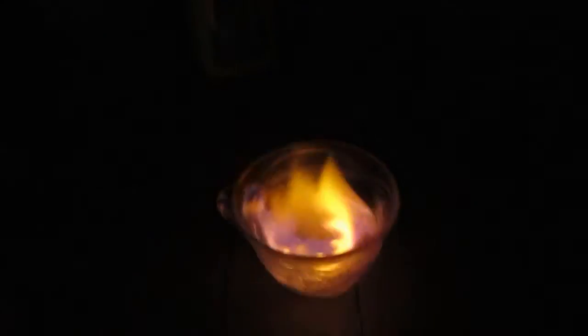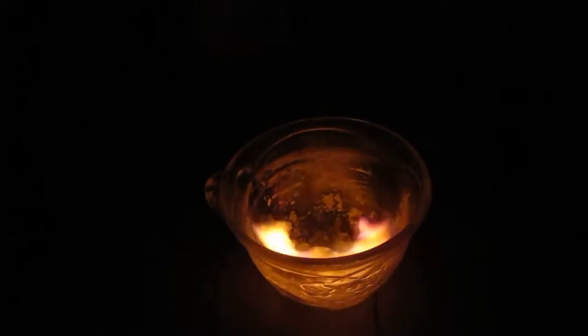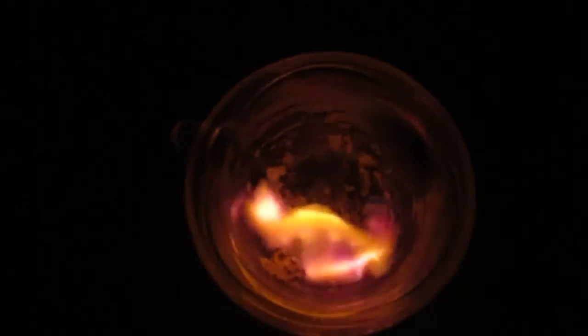Maybe there's a sodium contamination, but yeah you can see it's kind of magenta — yep, there we go. It's purplish red, and there we go.